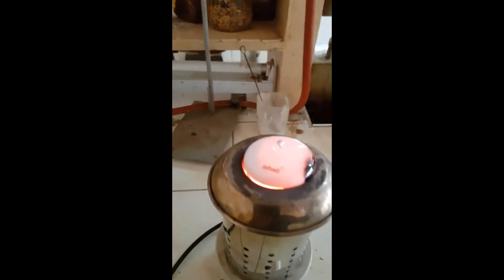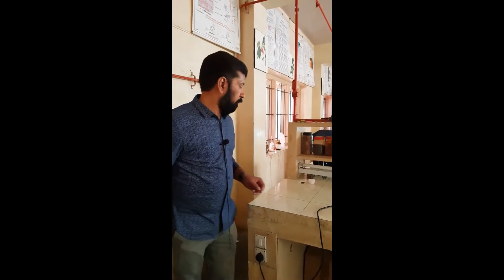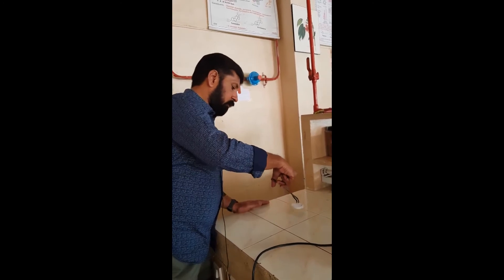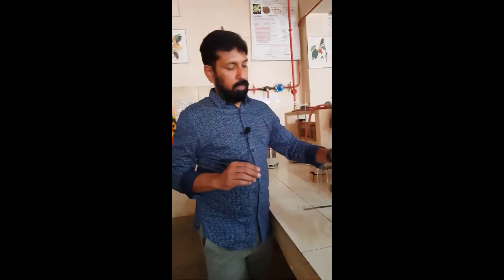Switch off the incinerator. Now take the lid and keep it in one corner, take the silica crucible and keep it in one corner, close it and lock it. You can see this incinerator has become red hot. So lock it and keep it for just a few minutes. After a few minutes, take this crucible and keep it in the desiccator. We keep it in the desiccator because it absorbs moisture from the room. Close the desiccator firmly and wait for another 20 minutes.